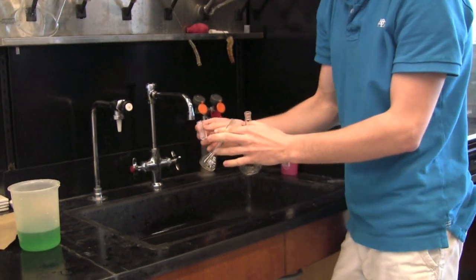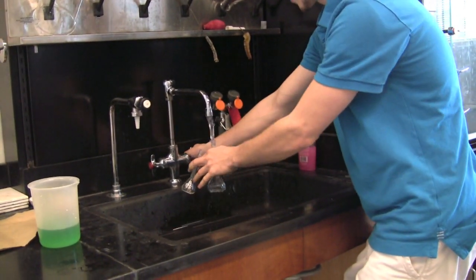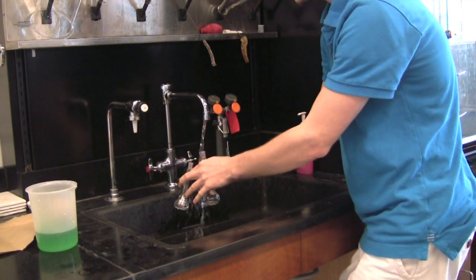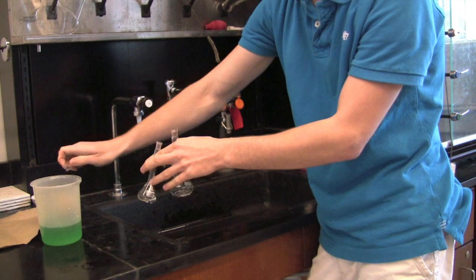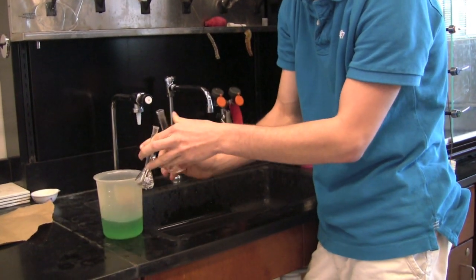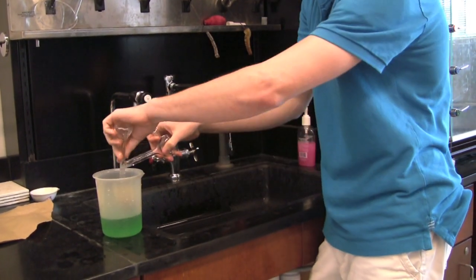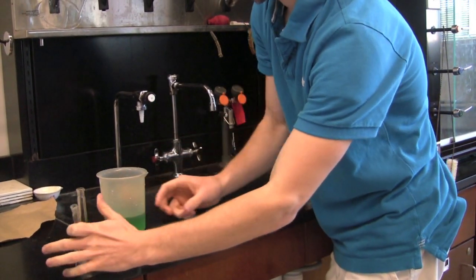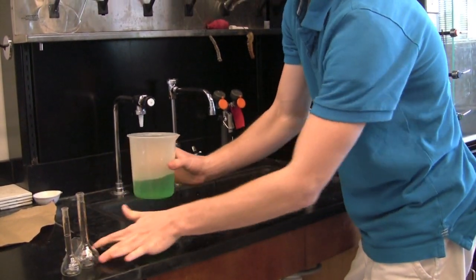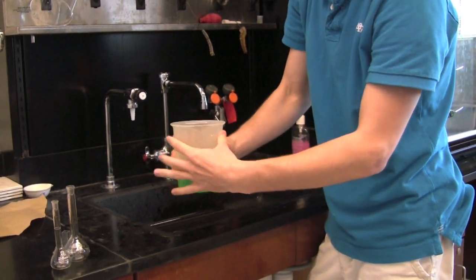Take your volumetric flasks and cuvette and using the water from the sink, rinse them out, pouring the rinse waste into the waste beaker. Allow volumetric flasks and cuvettes to dry before putting them in the appropriate places.